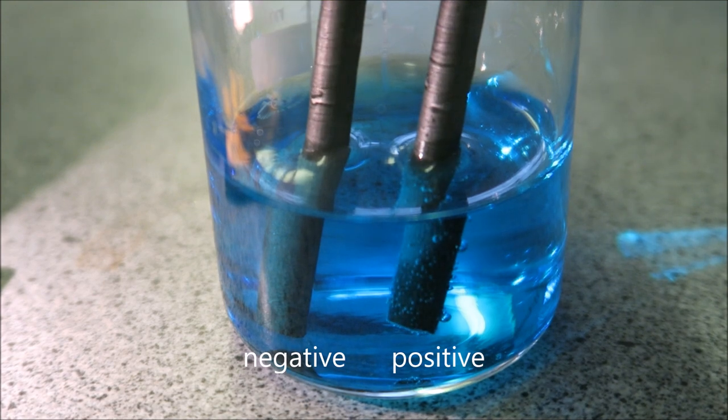Which is exactly what you would expect from copper sulphate solution. I'd like to thank the exam board for making me do that.